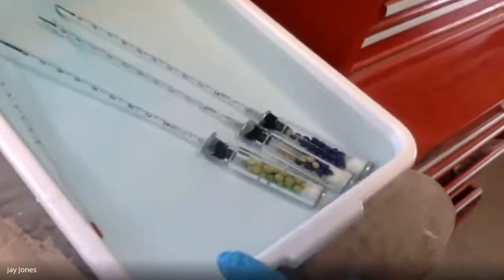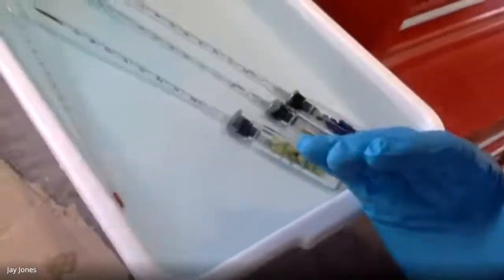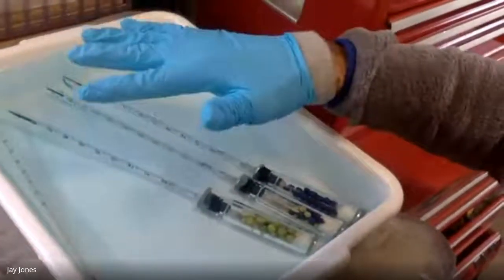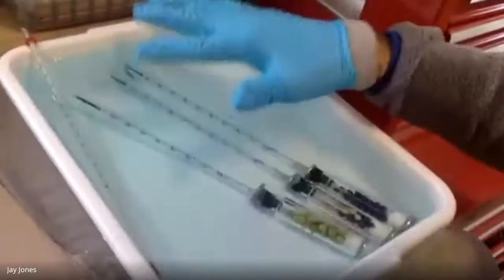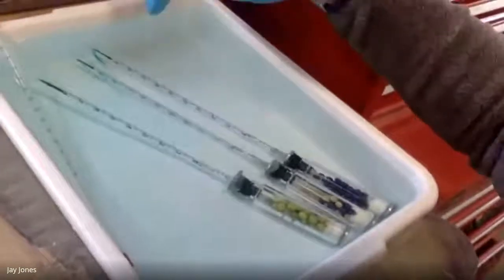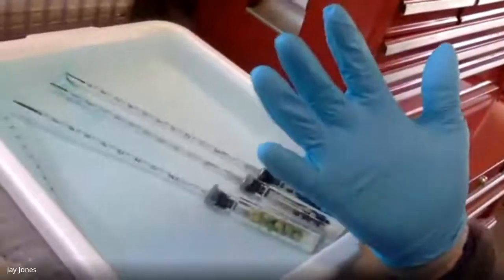But there are still little micro changes that occur in the temperature here and the movement of the water. The water's going to move. I'm going to bang into it. There are going to be slight differences in air pressure pushing on this water, like Torricelli's mercury column. Air pushes on this liquid water, and that could change slightly the pressure in the water, because the water moves and will move that color. So I have to account for that.